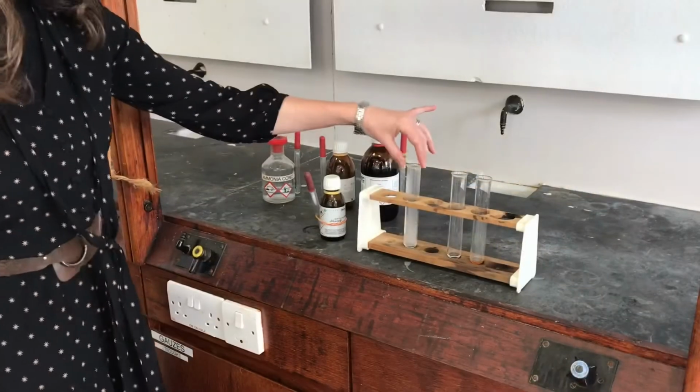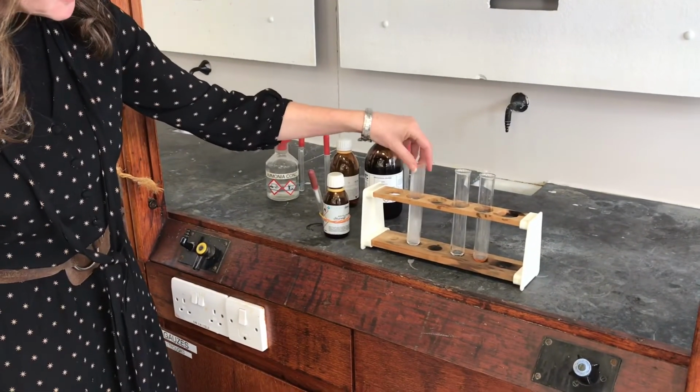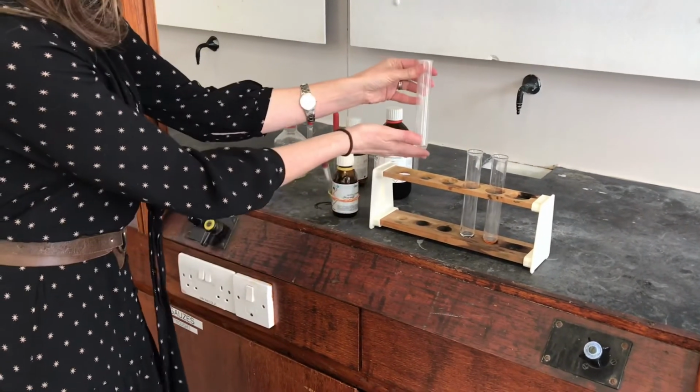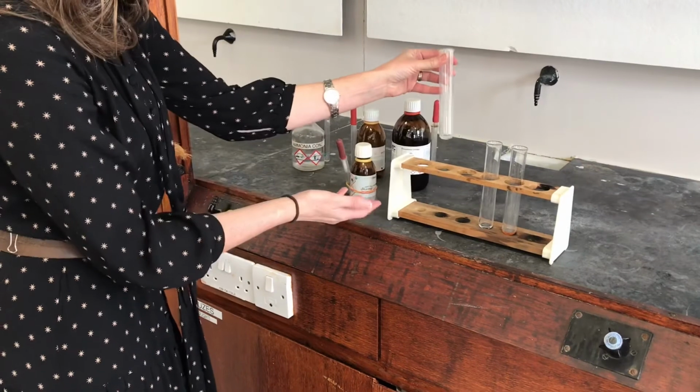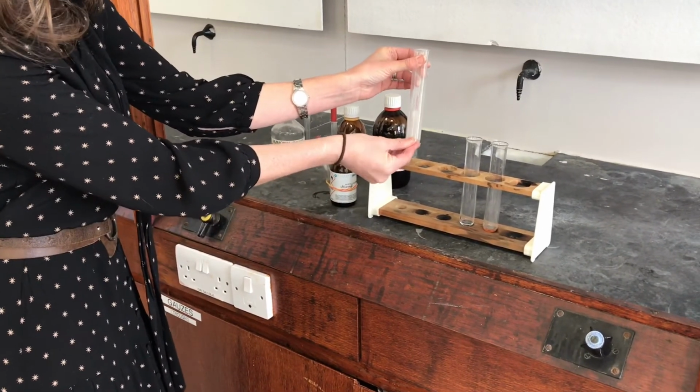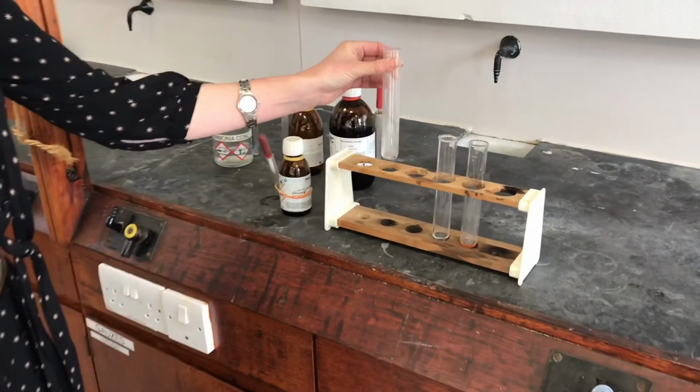Okay, so I've turned the fume cupboard on in between to try to let some of the fumes from that escape and so that I can actually breathe some fresh air. And while I was doing that, I also felt the bottom. It's still quite warm now. And even though there's a very small amount of liquid in there, it's generated quite a lot of heat, so it's quite an exothermic reaction.